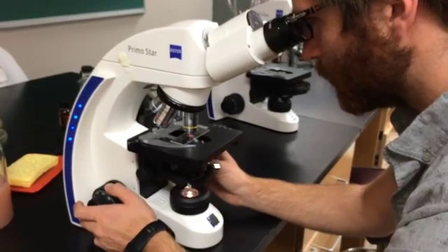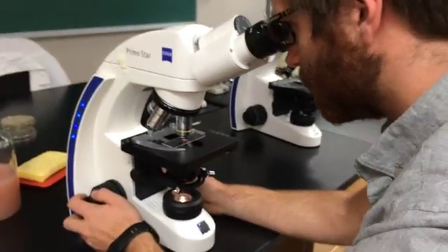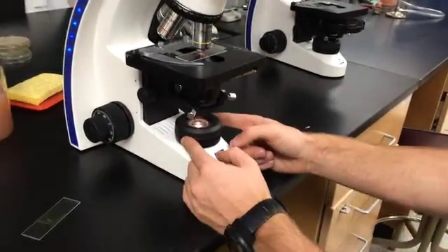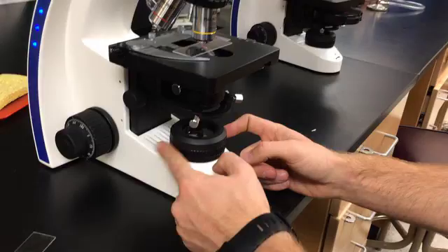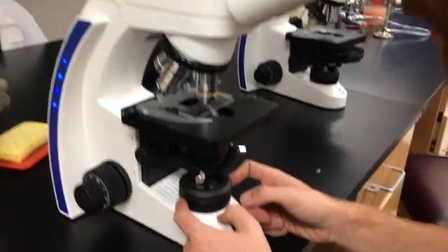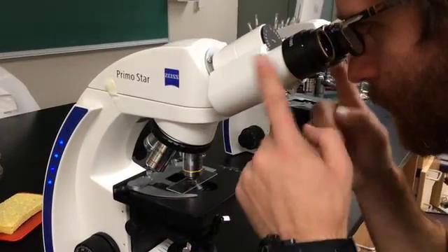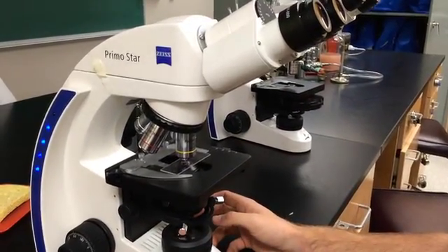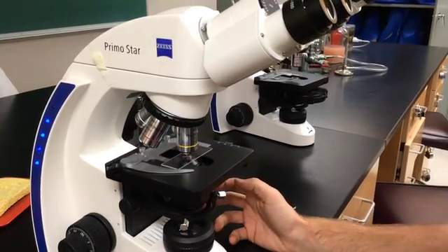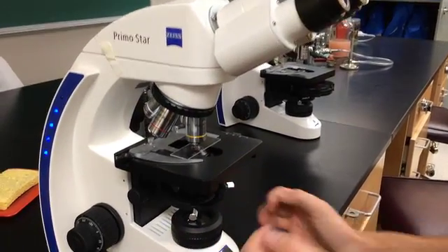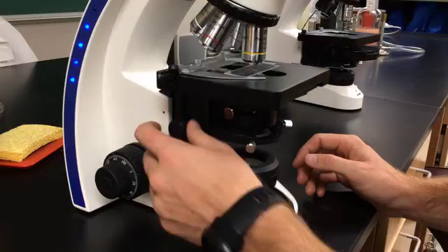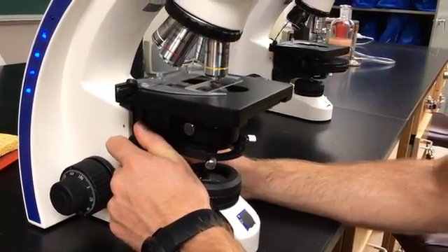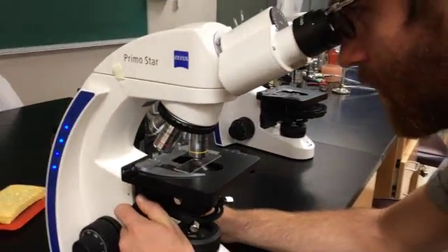It looks like a wax pencil of red. So once that's in focus, I'm going to close the lamp diaphragm down here all the way. I'm going to look through my oculars again. And I see a blurry circle. That blurry circle should actually be a shape. It should be an octagon almost. And I'm going to get it to be that octagon. I'm going to focus that blurry circle right now via this condenser adjustment knob. And it's just going to take a little bit. It shouldn't take a lot.